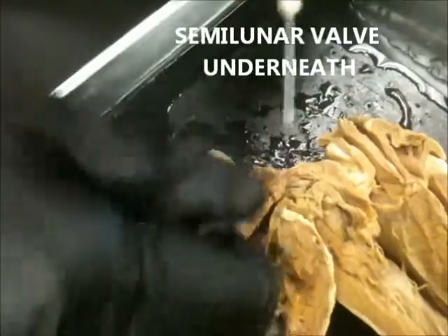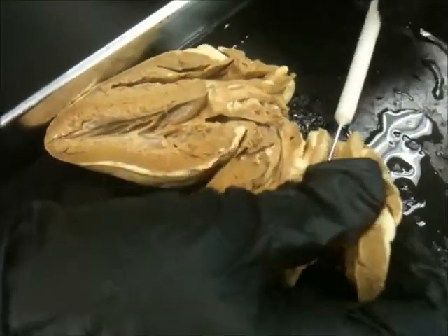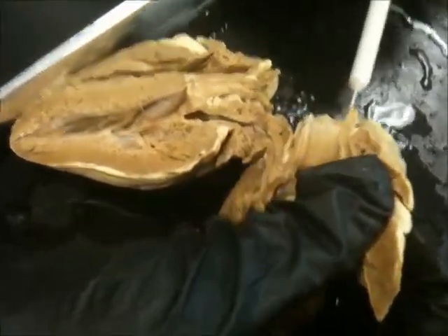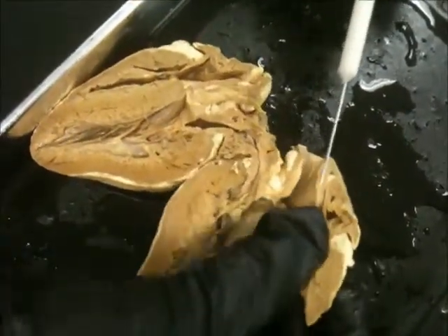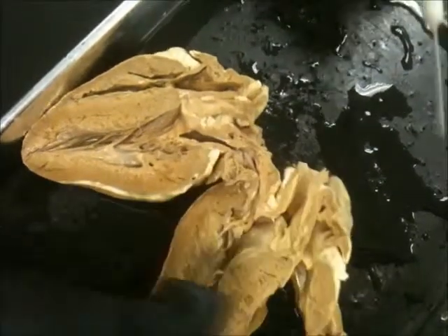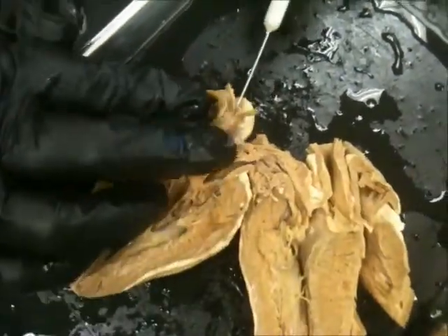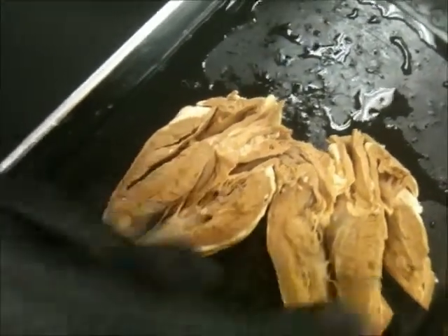Yes, look at that. You can smell it — it's killing me. You can stick something through it. You can see the artery. And then what else did we have to learn? The pulmonary. Where is the fossa ovalis? Can you find that in there? That hole right there?